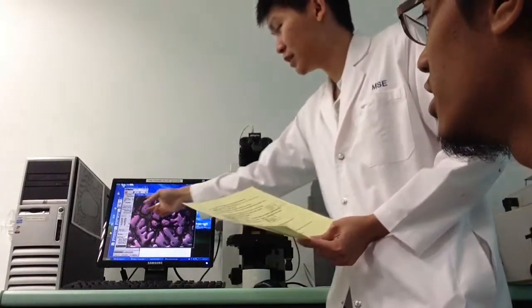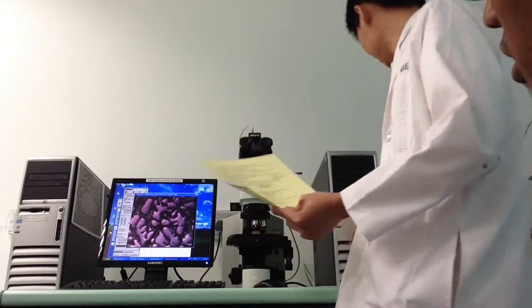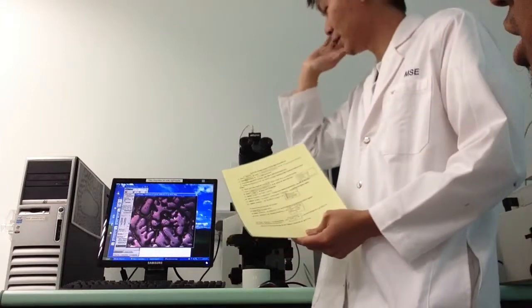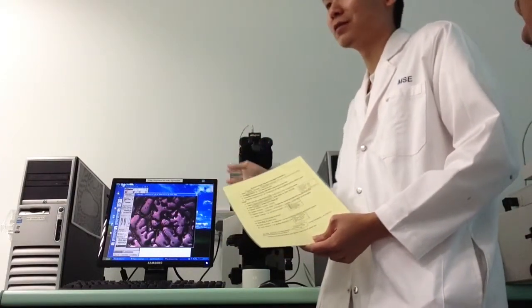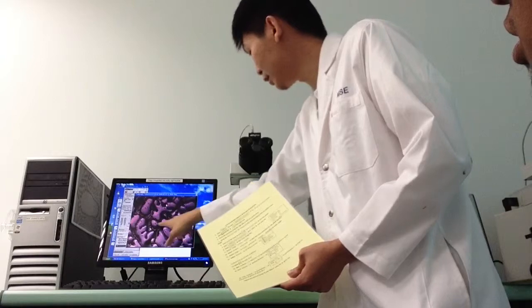This image is still a color image. But when you turn it to black and white, you should be seeing something like what I've just shown you just now. For demo purpose, I won't be searching through everything just to find the perfect demo, so I'll probably just use this one.